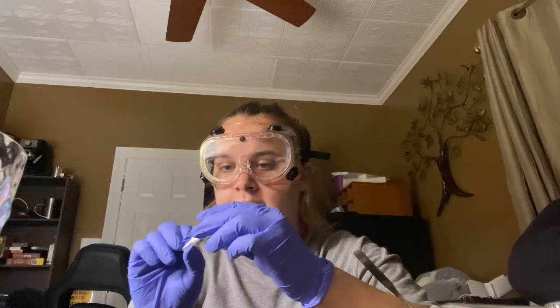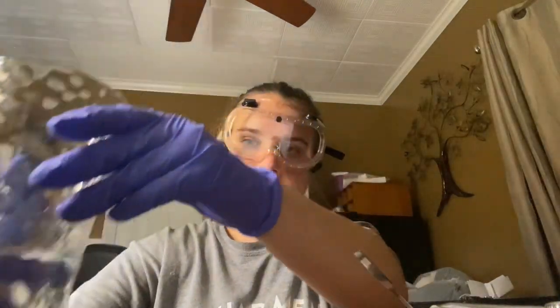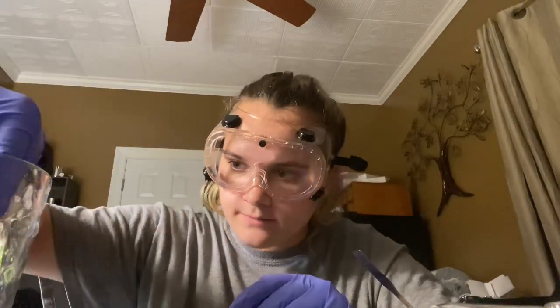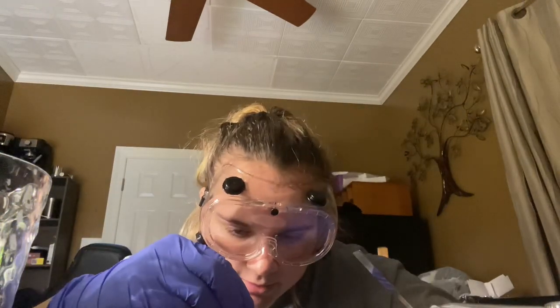So now we're moving into the second part of this exercise. So it says place a pea-sized amount of unknown 106, which looks like this, into an empty well of the well plate right here. And then it says use the empty pipette to add 1 to 4 drops of distilled water directly onto the chemical. So let's use distilled water to add 1 to 4 drops. So I'll add 4 drops.